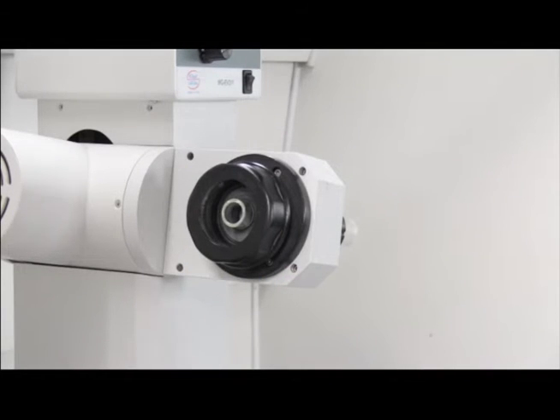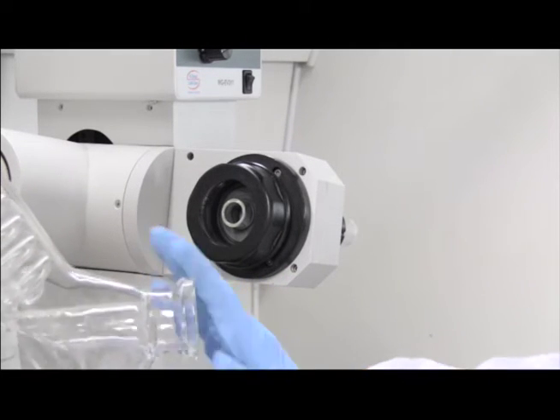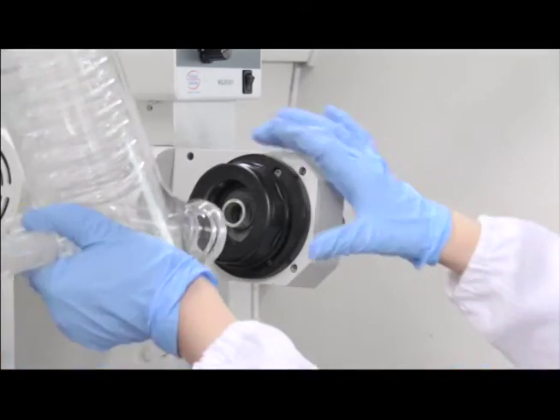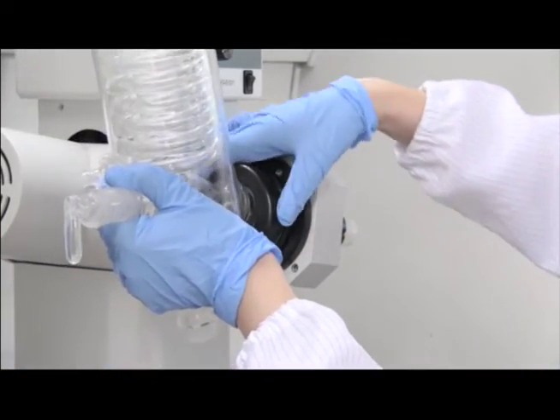The glass condenser has a flange connector. Slide the flange onto the union nut with one hand, making sure that it is in proper alignment with the vapor duct.